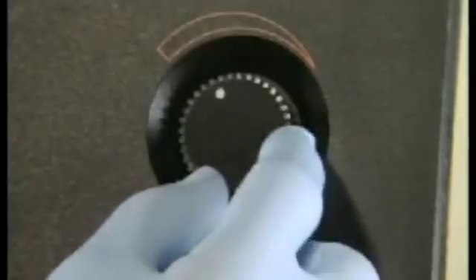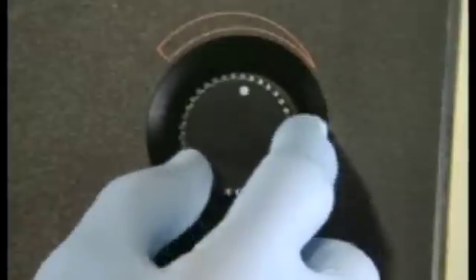Then replace the blank solution by a dilute solution of the element to be measured, in this case sodium. Check that the correct filter is in place. Then reduce the flow of fuel until the meter reading is at a maximum.